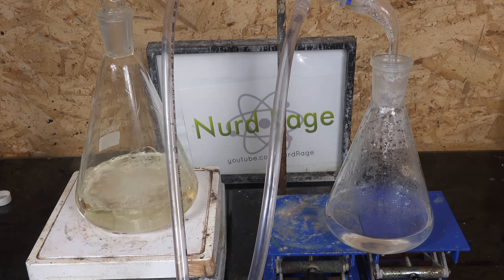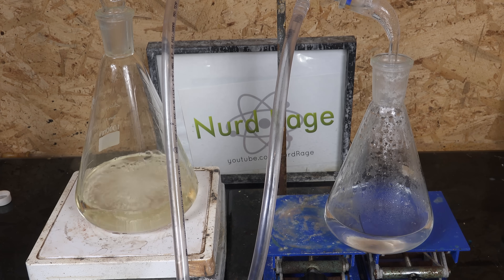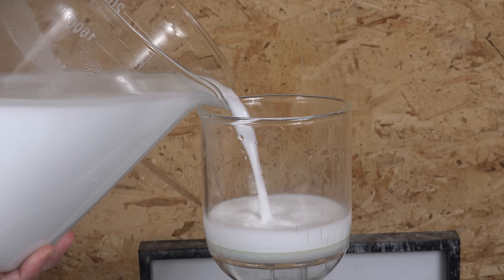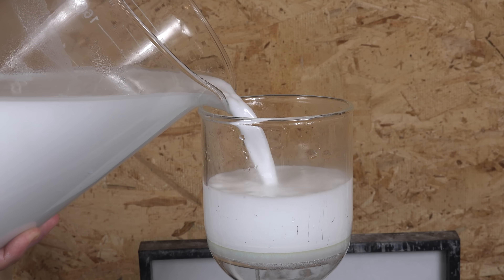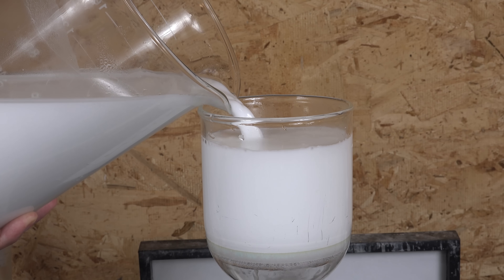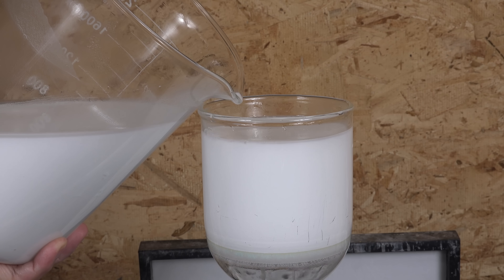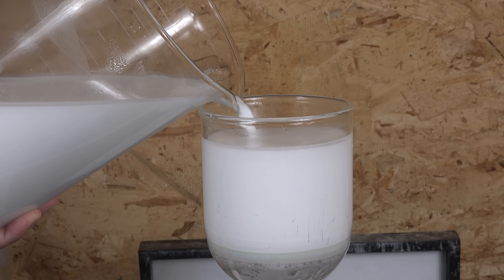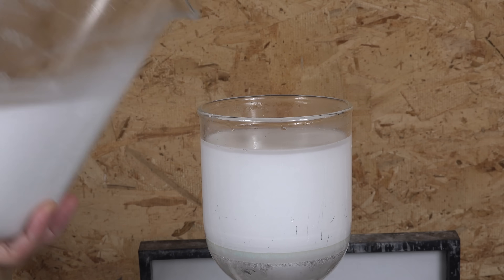This makes oxalic acid a viable alternative to sulfuric acid and sodium bisulfate when making nitric acid. Oxalic acid is much less restricted, and I find this filtering process much easier to handle and clean than calcium sulfate precipitates when using sulfuric acid. Anyone that has made nitric acid with calcium sulfate byproducts can attest it's absolutely awful to filter and deal with. Many amateurs go through the trouble and expense of converting calcium nitrate into sodium or potassium nitrates just so they don't have to deal with calcium sulfate. But this oxalic acid process lets us skip that.